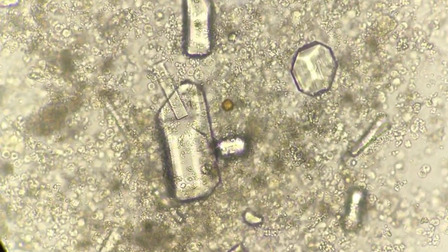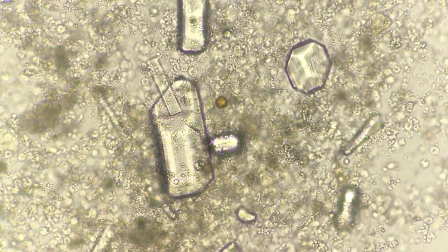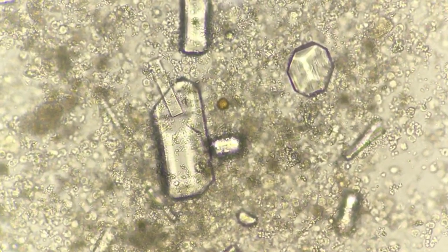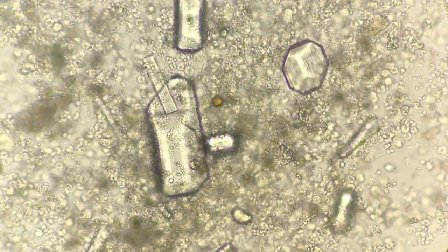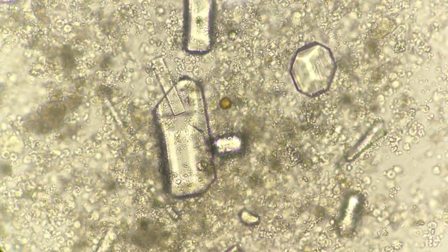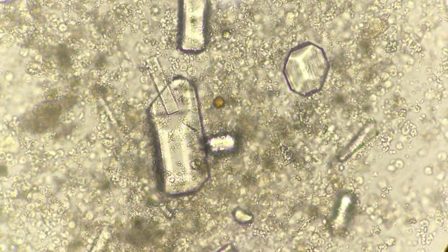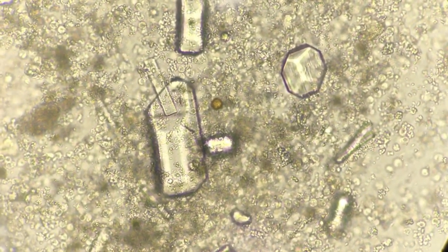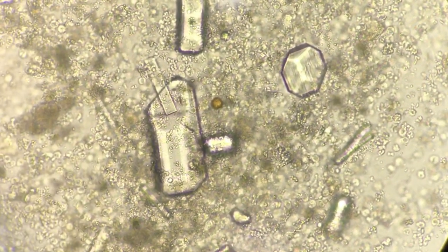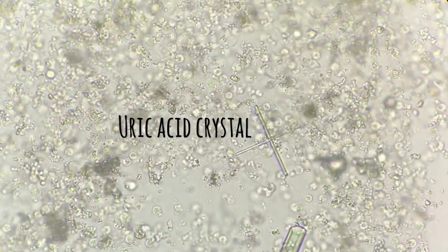This is how it looks in microscopy. You can see many struvite crystals, granular casts, and a lot of WBCs in the background, and a lot of bacteria as well. I think this sample deserves a cytological examination. The one in the center looks a lot like a uric acid crystal.